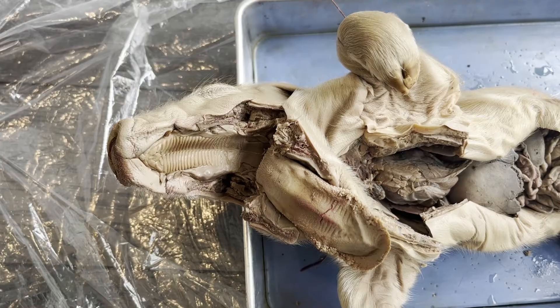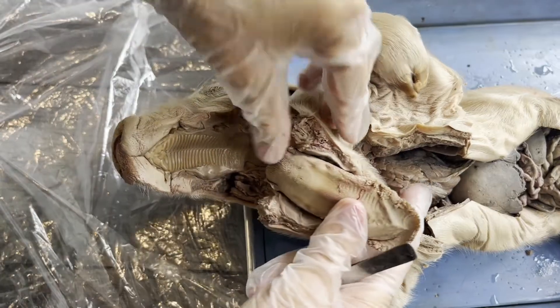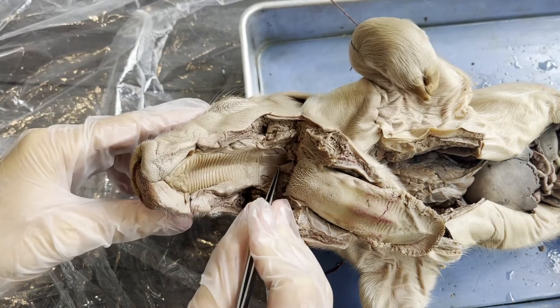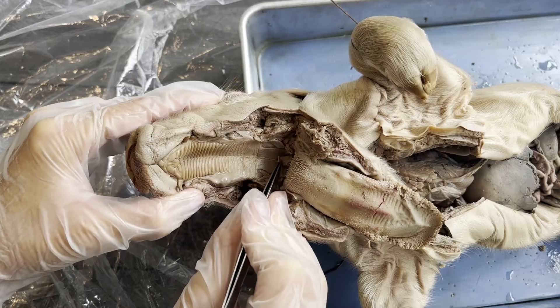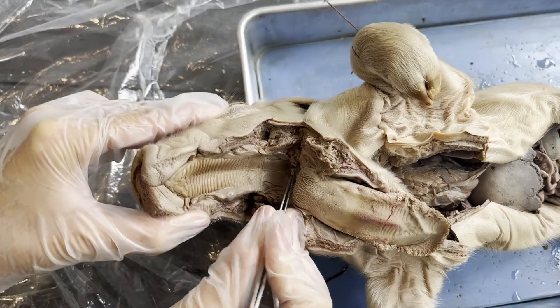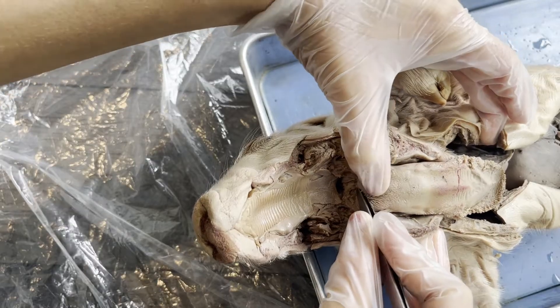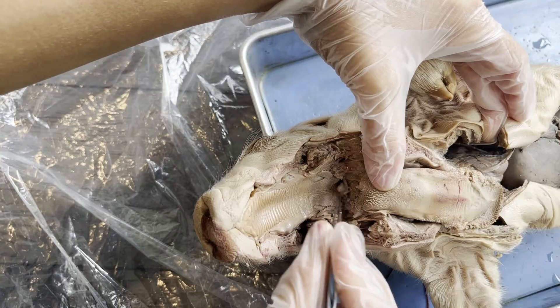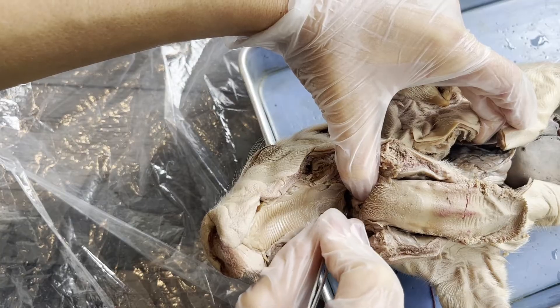We're moving on to the respiratory system. Pigs breathe in through their nose and mouth like humans do, and as that air travels to the back of the mouth, we have a structure we've talked about already. This flap is known as the epiglottis. The epiglottis covers up the trachea to make sure that food and water don't go down the trachea when we're eating, and it opens up when we're breathing to make sure air can go down the trachea. In this specific fetal pig, it's really hard to see the difference between the trachea and the esophagus, but there probably is an opening to the trachea back here.